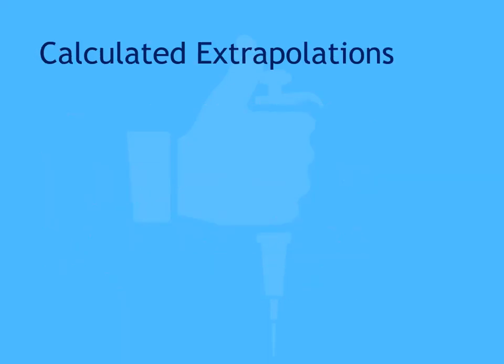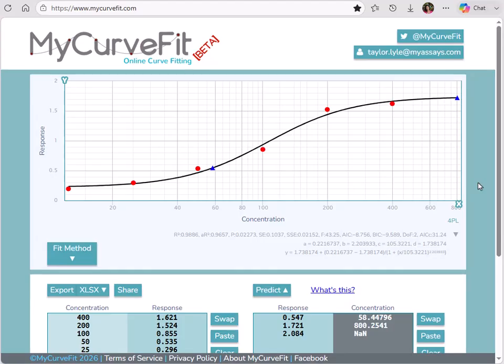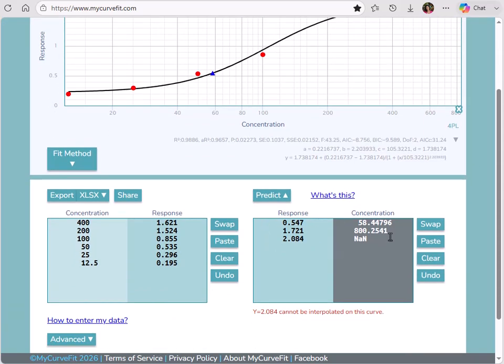Whether or not MyAssays can calculate an extrapolated value depends on several factors: the fit method, the shape of the curve, the response value, and the analysis rules applied. Let's take a look at a couple of examples. I have opened mycurvefit.com with an example dataset plotted using a 4PL fit. I'm using myCurveFit for these examples because it allows us to easily try different fit methods and quickly see the results. I also have 3 responses I've added to my predict table.